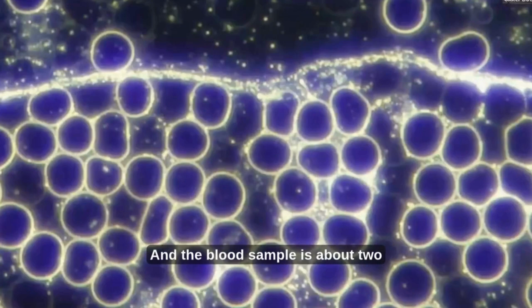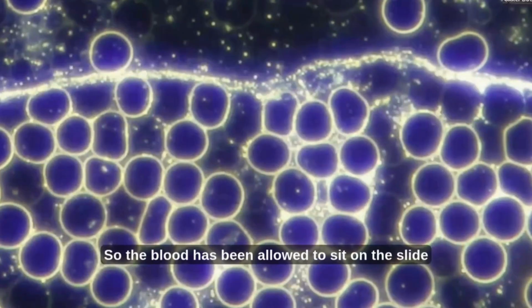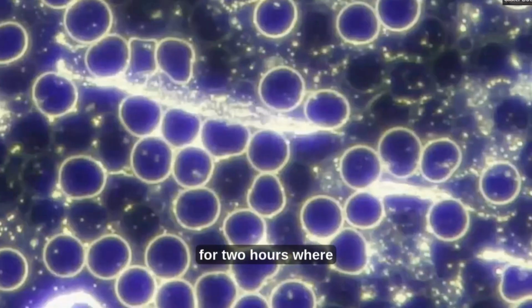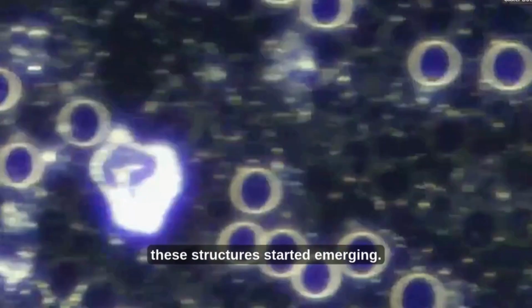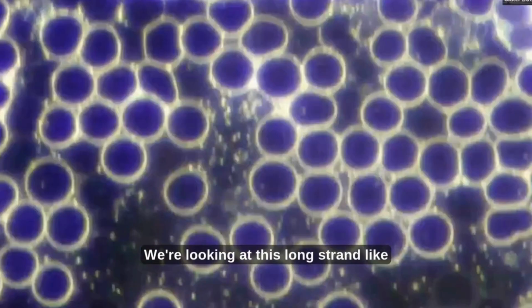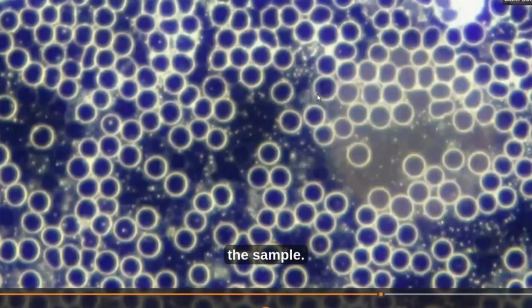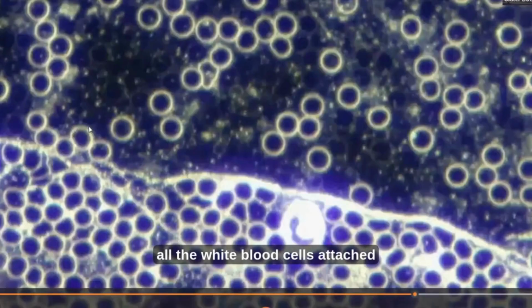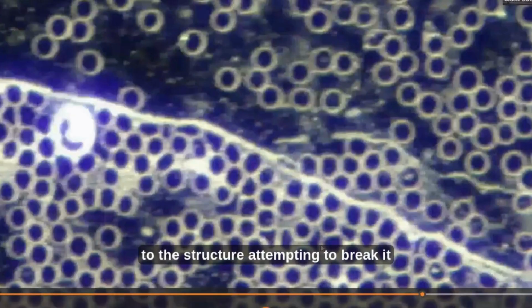the blood sample is about 2 hours old. So the blood has been allowed to sit on the slide for 2 hours, where these structures started emerging. We're looking at this long strand-like structure running across the sample, and very interesting to see all the white blood cells attached to the structure, attempting to break it down.